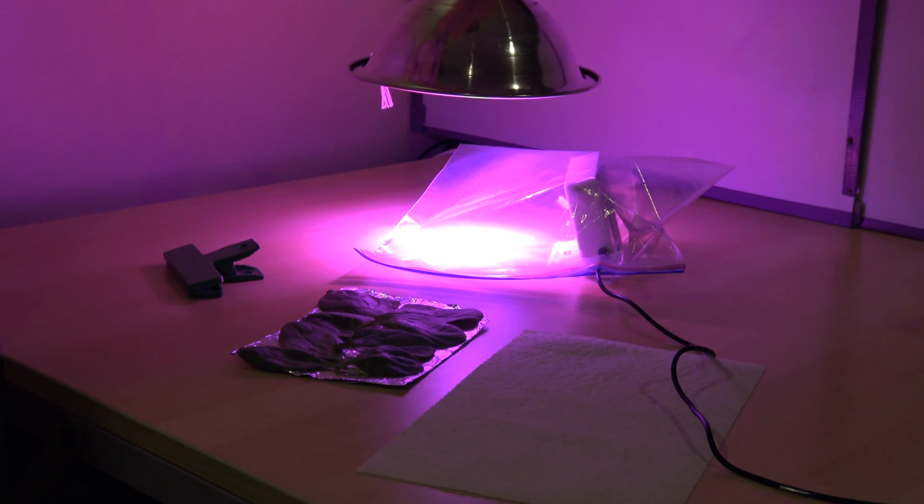After five minutes we can take our stabilized readings for carbon dioxide and water and then we're ready to place the tray of leaves inside the bag.